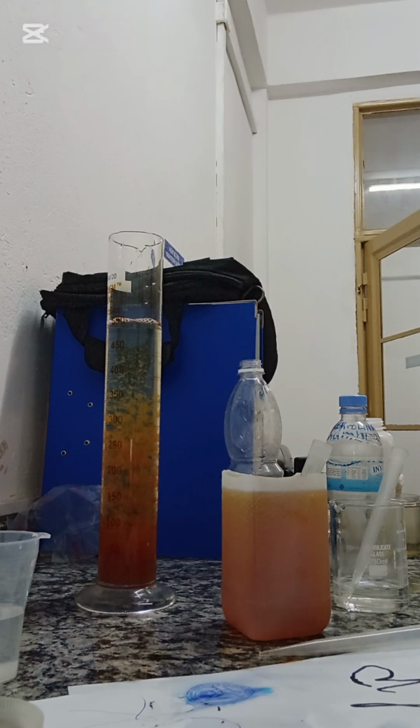As you can see, a sample that was initially a wastewater sample with high levels of total suspended solids and turbidity is now less turbid. Two, it is easy to remove the suspended solids because now they have separated from the water.